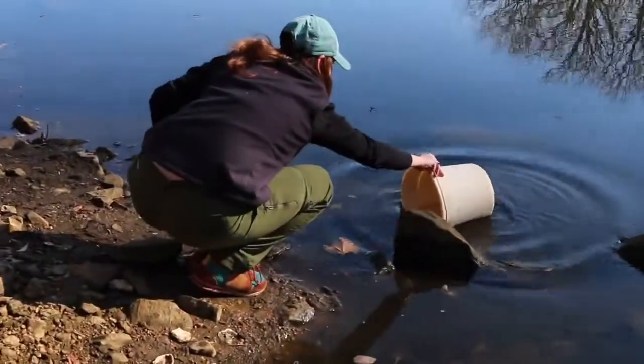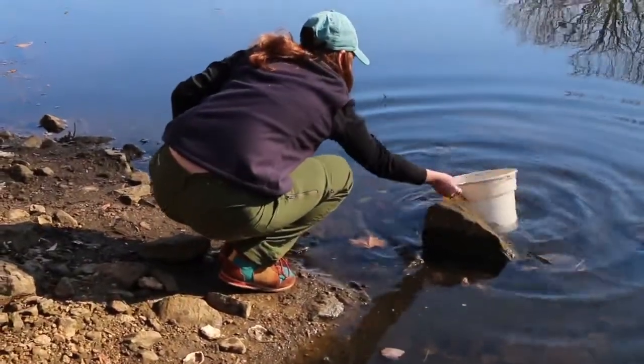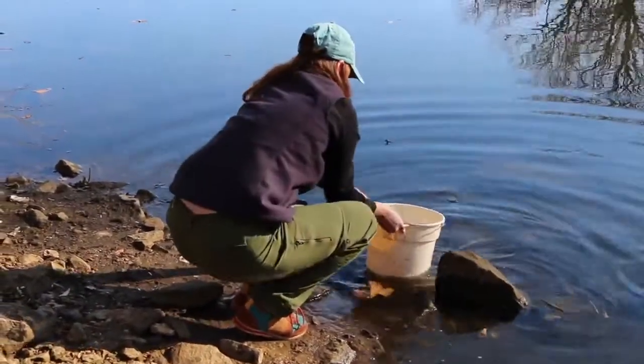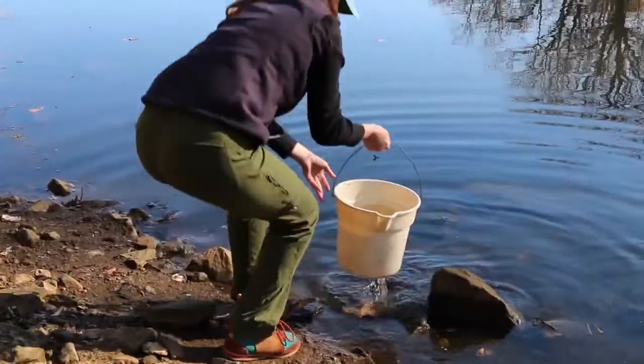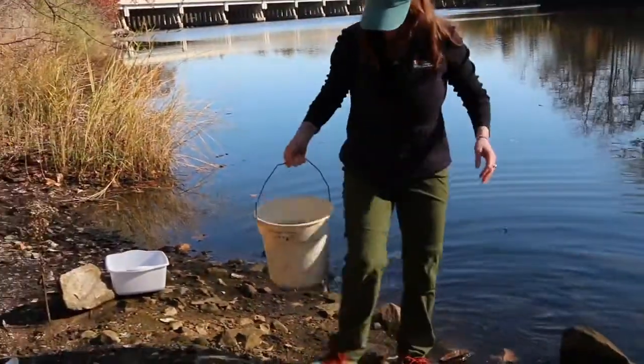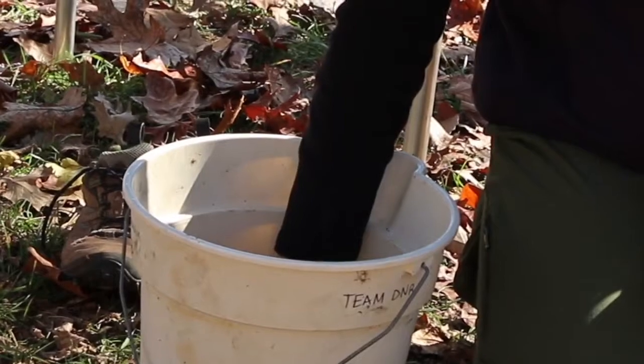You can test right from the stream in your waders, or from the shoreline, or you can fill up a bucket and bring it to a table to make it a little bit easier. You want to fill the vial all the way up.